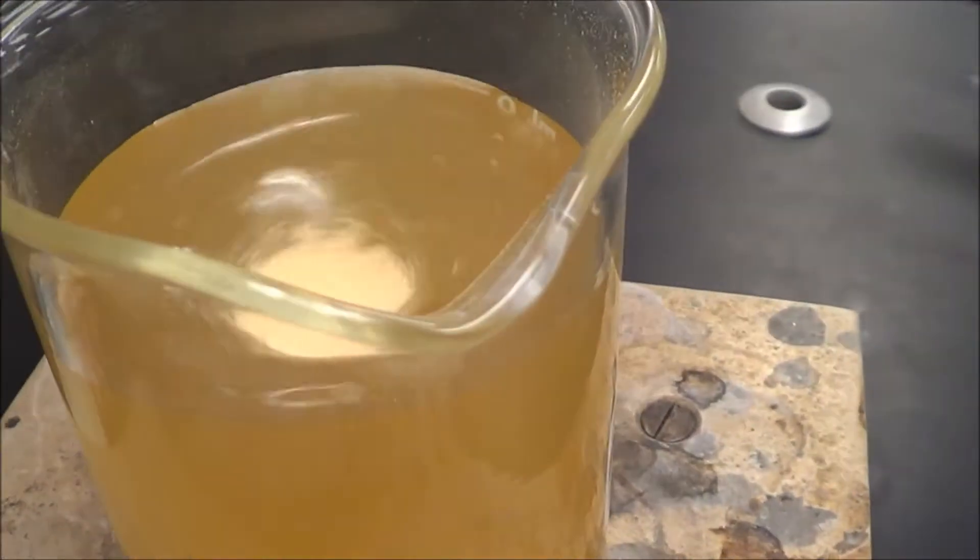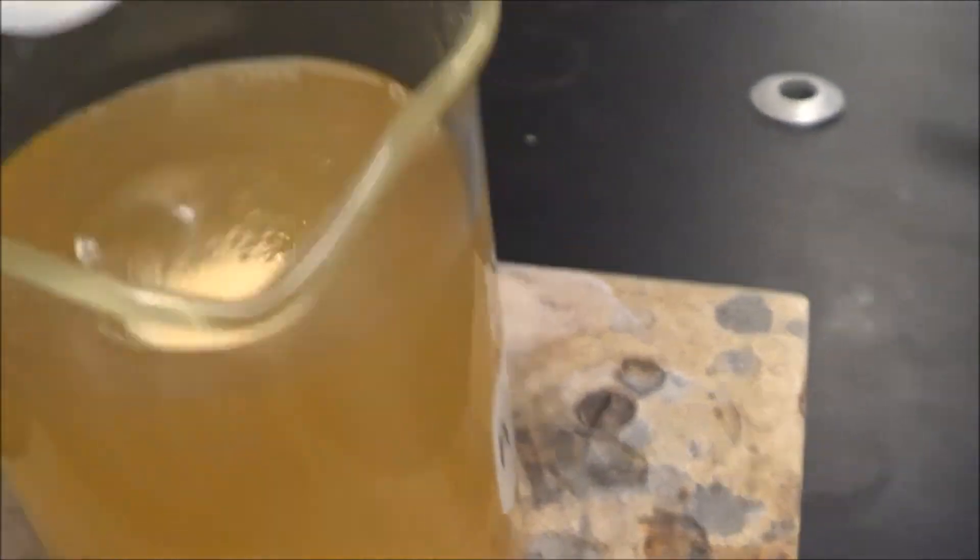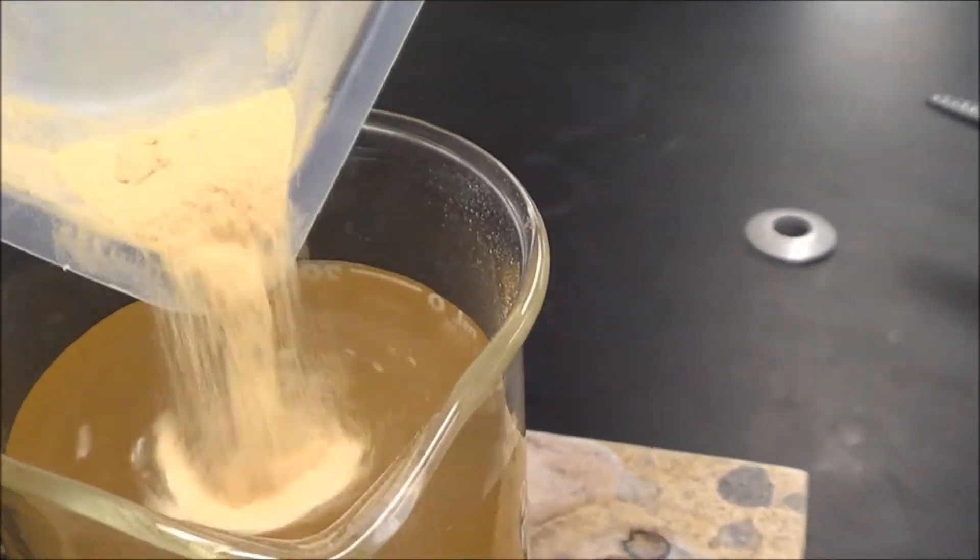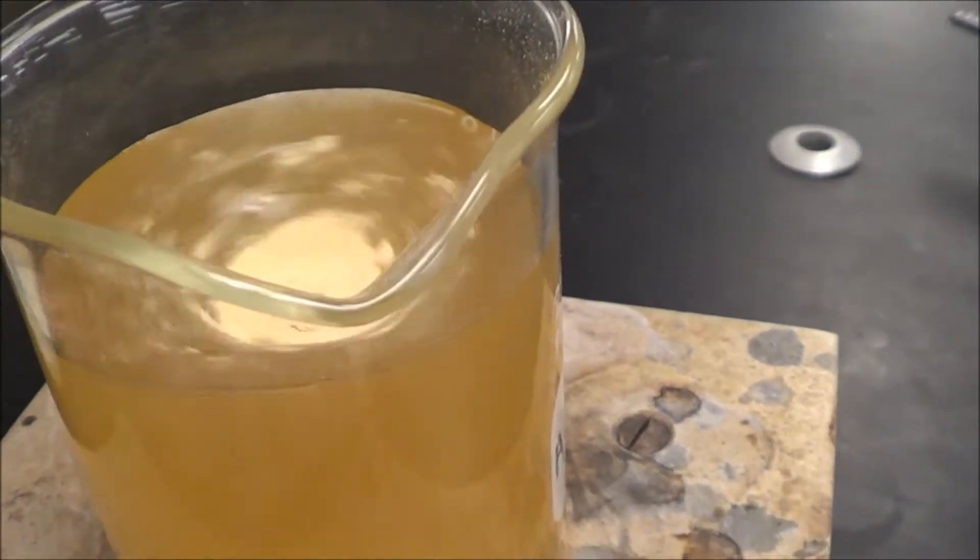If you can't find agar in stores, then you can probably find it online. You can pretty much find anything online. So, more in there.